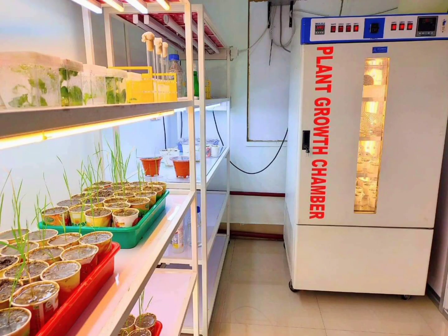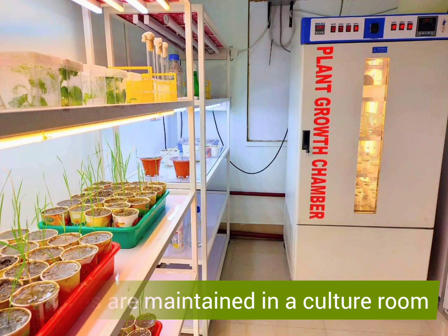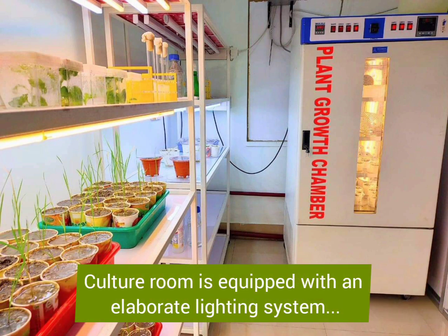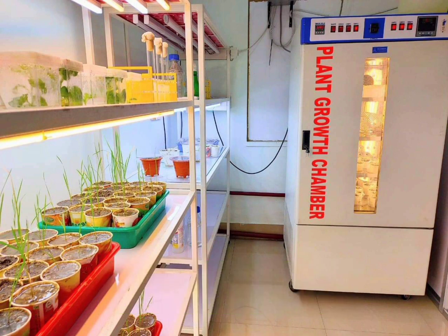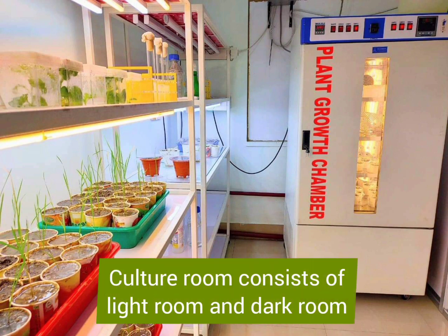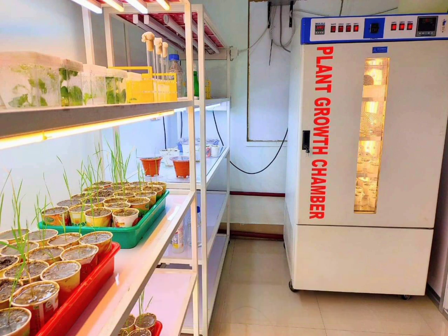Finally, the cultures are maintained in a culture room. This room is equipped with an elaborate lighting system along with temperature and humidity controlling systems. For rice tissue culture, the culture room typically consists of a light room and a dark room, both with controlled temperature and humidity.